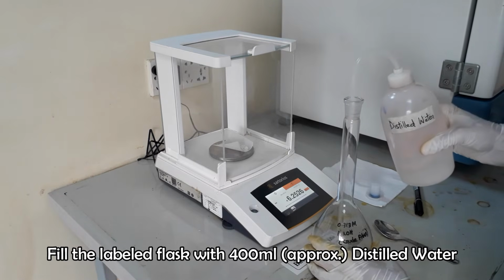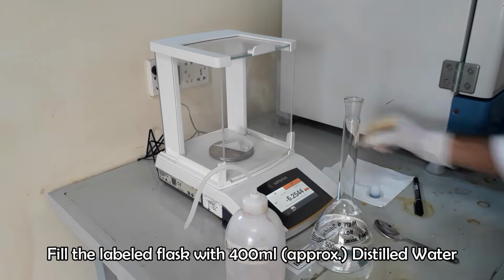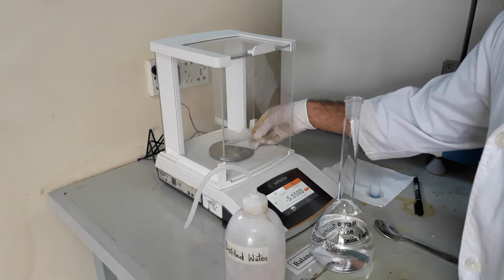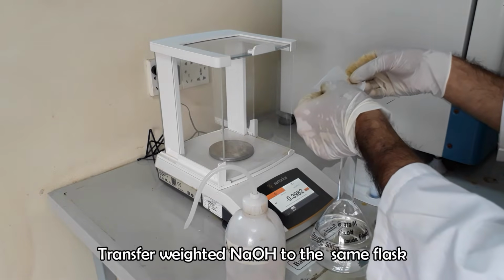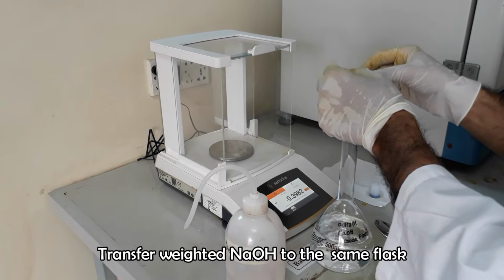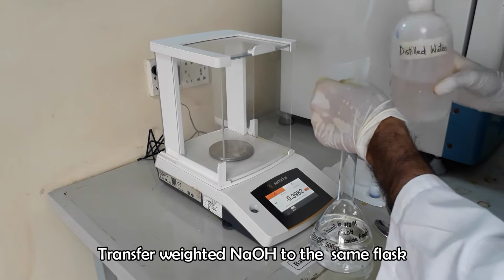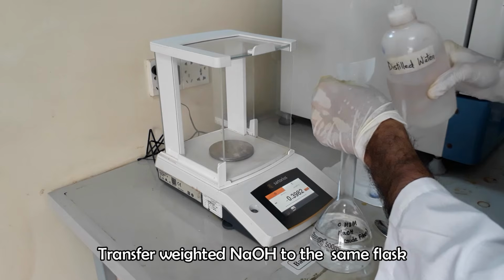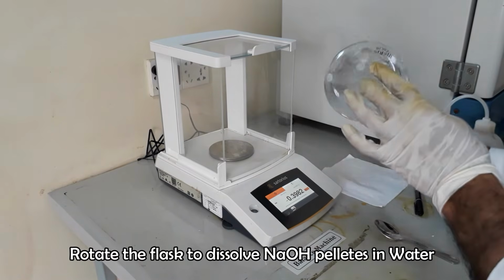Pour approximately 400 milliliters of distilled water into the volumetric flask and transfer the weighed sodium hydroxide into the same flask. Shake the flask to dissolve pellets in water.